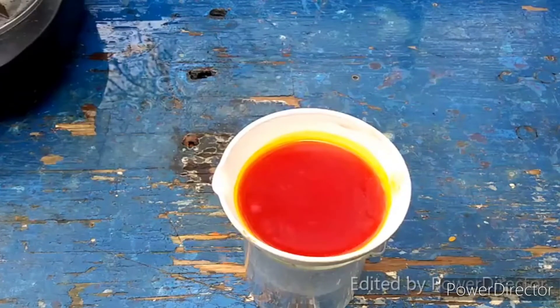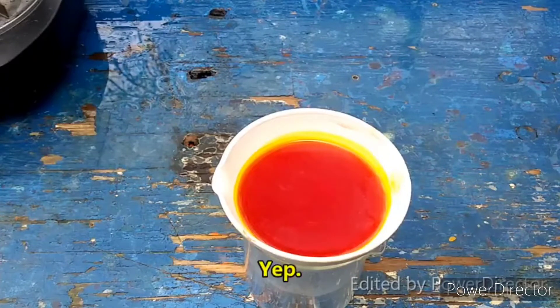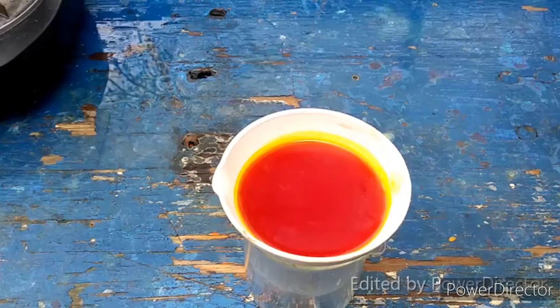I'm not sure if it's going to turn into a completely solid chunk, which sometimes happens. With hydrates, they will get down to a point like this and then you'll basically end up with a solid mass that has very little liquid left in it. I guess we'll see.